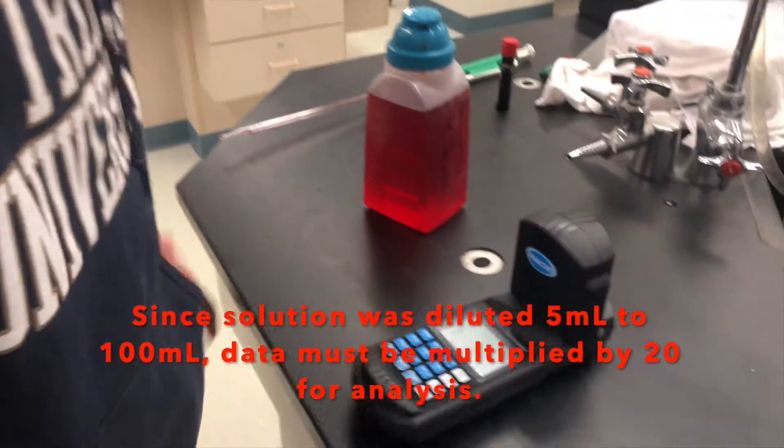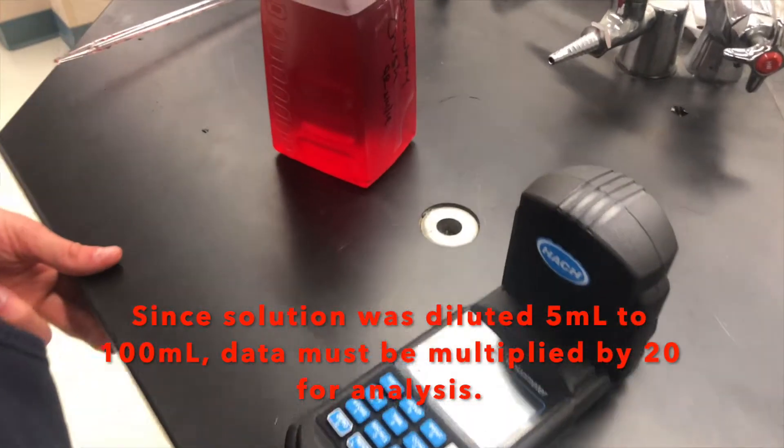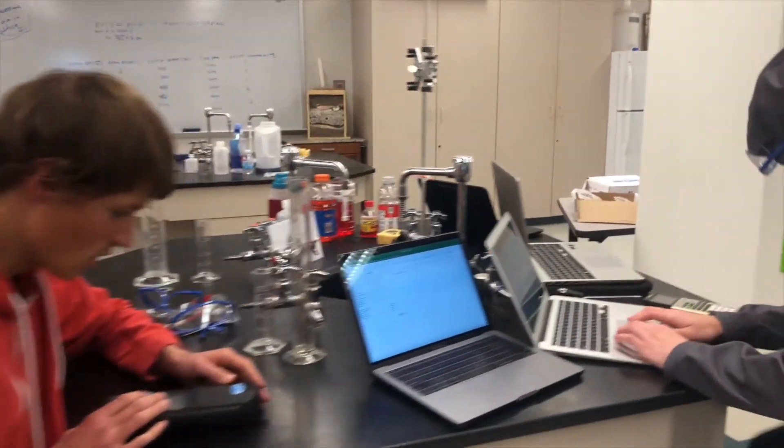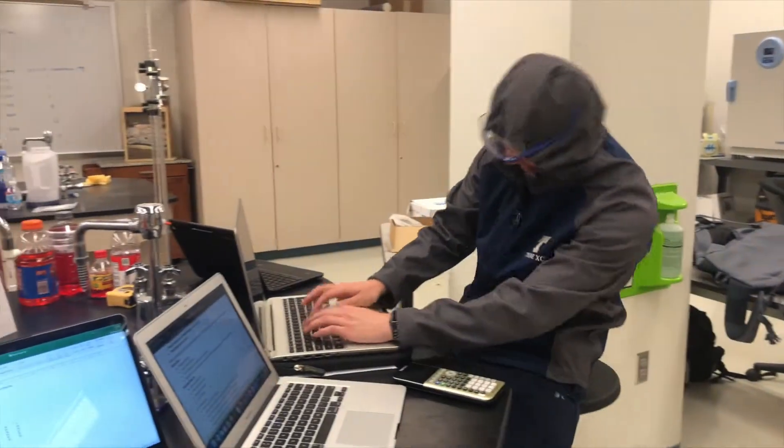Now we're going to try again. Hit read this time. And we've got a better value of 1.44.